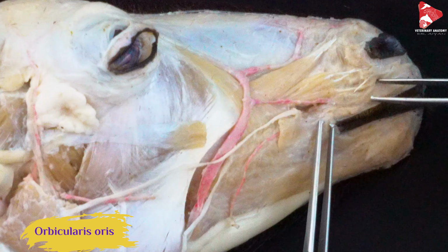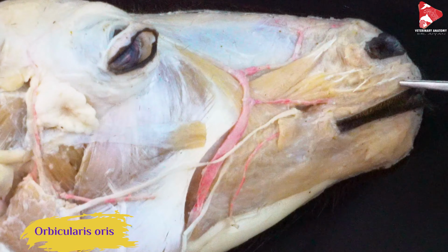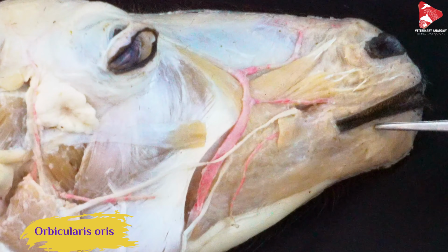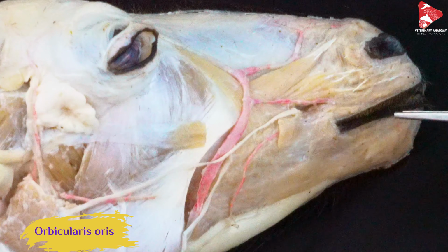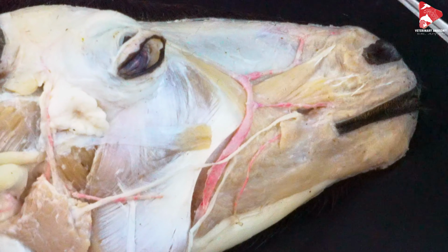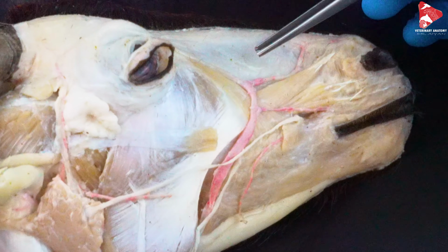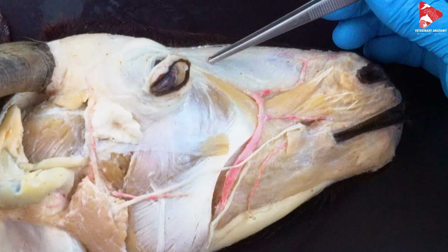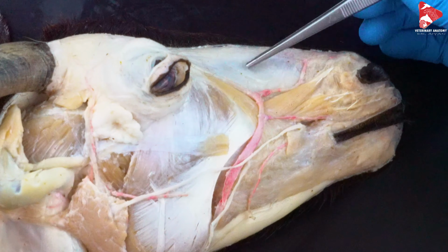Here, we removed the levator nasolabialis muscle to be able to follow the branches of the facial vein.